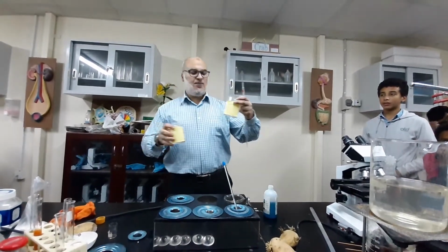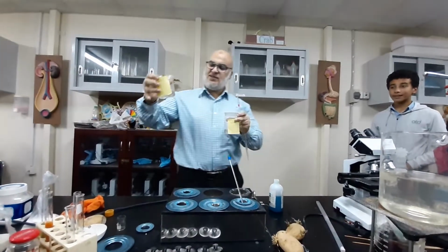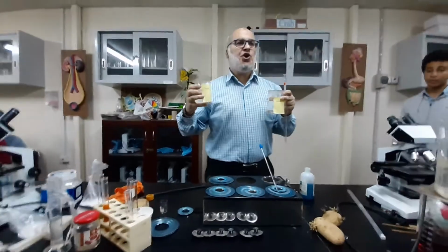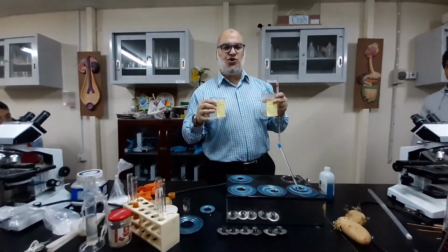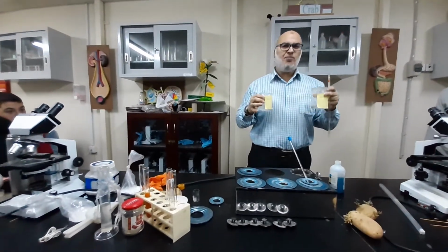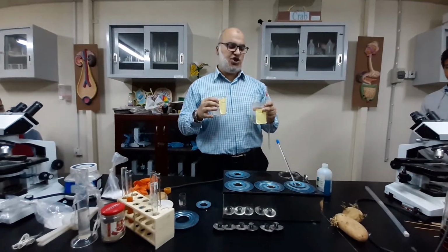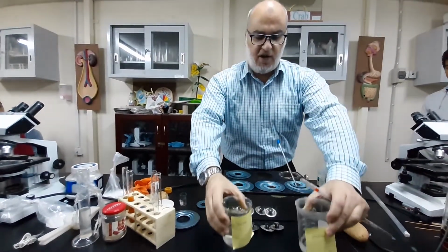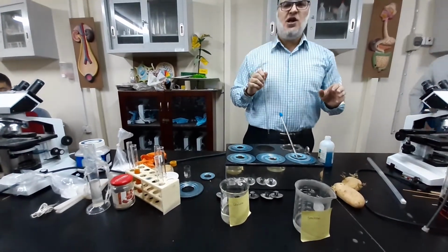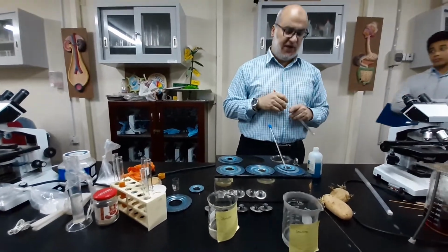One is sucrose, this one, and one is glucose, this one. And we're gonna know which of them is a reducing sugar, which of them is gonna lead to the change in the color from blue to whatever, and which of them is not gonna cause the change of the color of the Benedict's reagent, or changes the color a little bit. This depends on how much reducing sugar each contains.